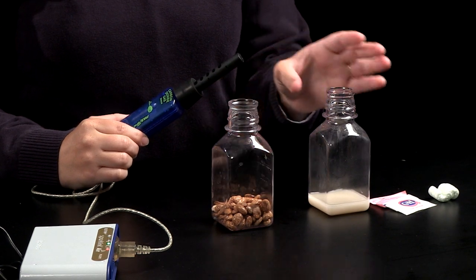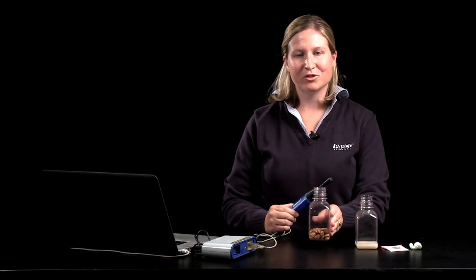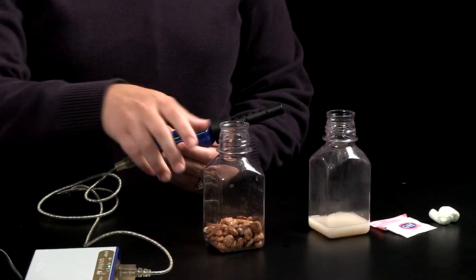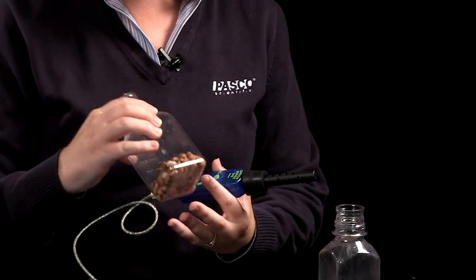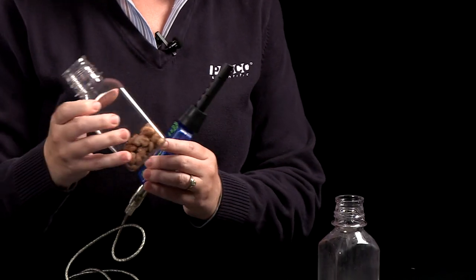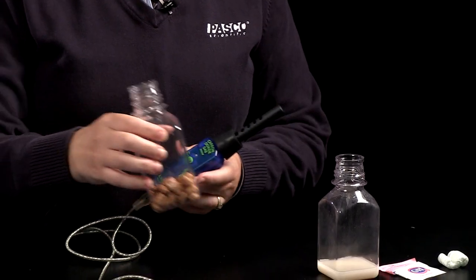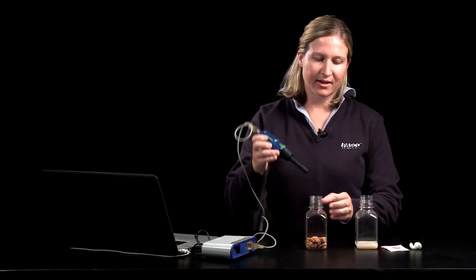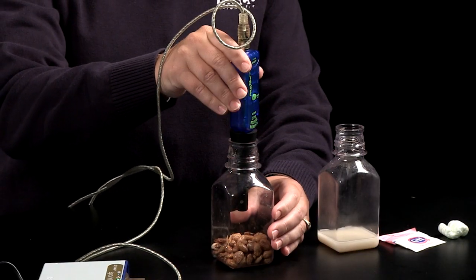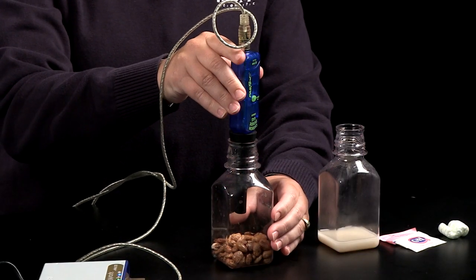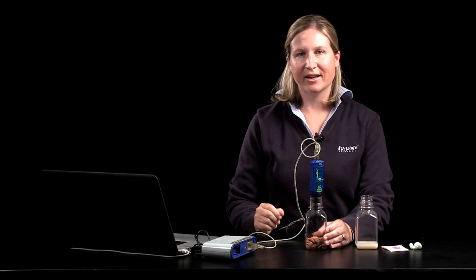The most common use of the carbon dioxide gas sensor is for experiments about cellular respiration. And you can use a number of different organisms for these experiments. You can use germinating seeds, you can use a solution of yeast, or you can go to the pet store and get crickets or mealworms. Students always find it exciting if the living thing that they're studying actually moves around. But for today's video I'm going to use germinating seeds and I filled the sample bottle up to the 50 milliliter mark on the side of the bottle with some germinating seeds. They've been soaked in water for about 24 hours. You can leave them for one or two nights before your students use them and just make sure that germination is evident in the seeds. You can plug the sample bottle with the carbon dioxide gas sensor and then hit play to start collecting your data.